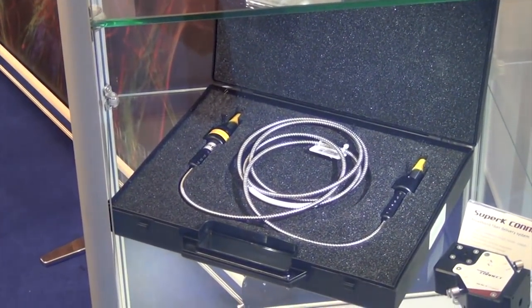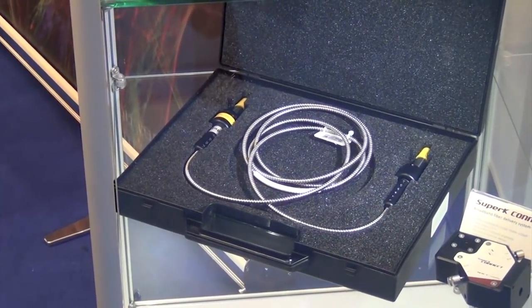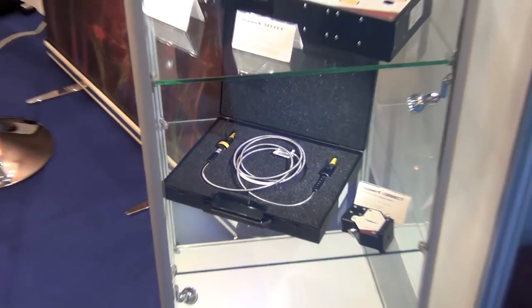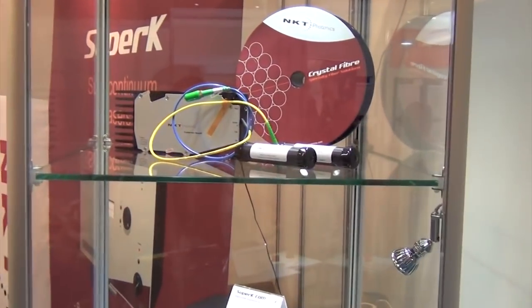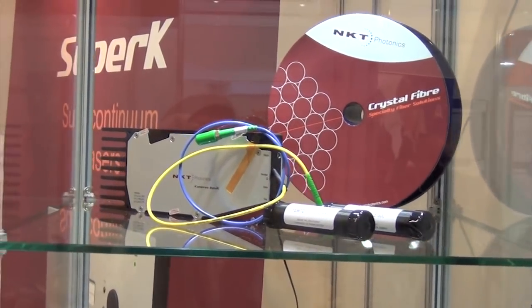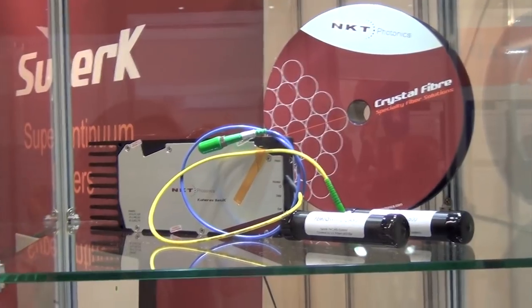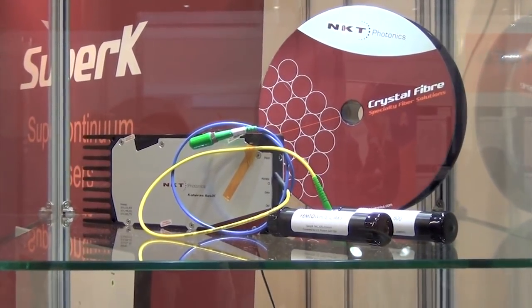As mentioned, this can be provided either as a fiber connectorized output or a collimated output. We also make non-linear fiber solutions — we call them Femto White CARS or Femto White 800. These are for customers who want to create their own super continuum using their own pulsed lasers, like titanium sapphire lasers — a more affordable solution for those who cannot afford a complete super continuum system.